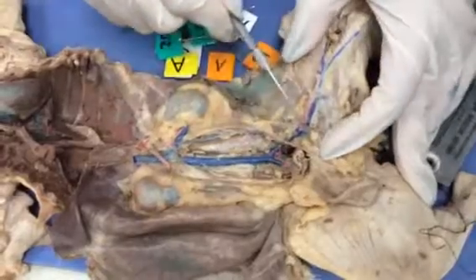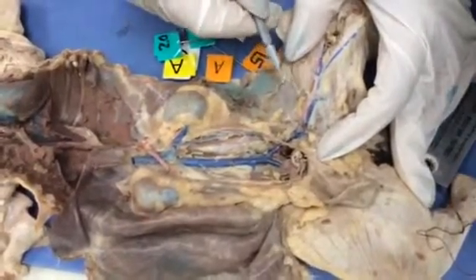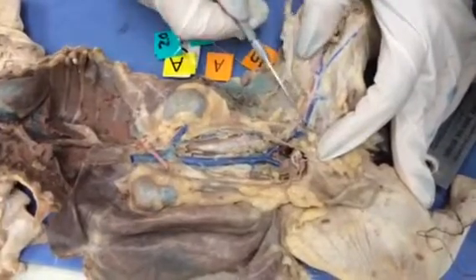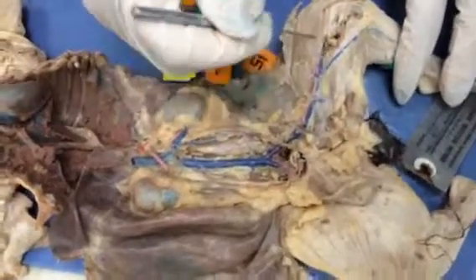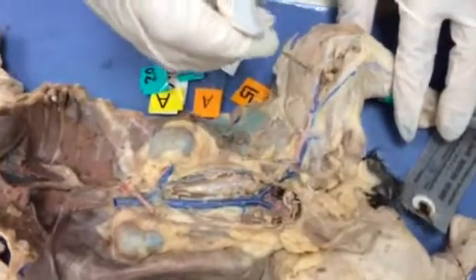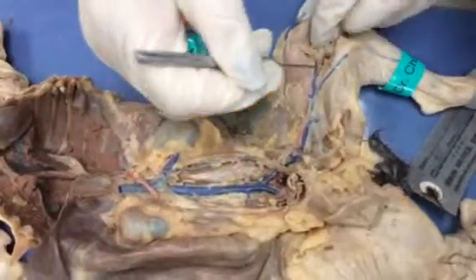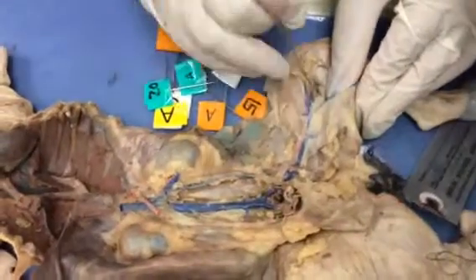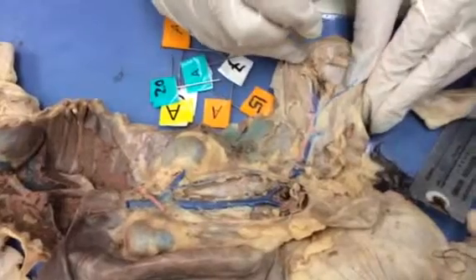The femoral gives me a small branch before it continues into the thigh that is called the deep femoral vein. Here we see the femoral. That femoral gives me a branch that goes above the knee that is called the superior articular vein, and one that goes behind the knee that is called the popliteal vein. This is the popliteal vein, behind the knee.